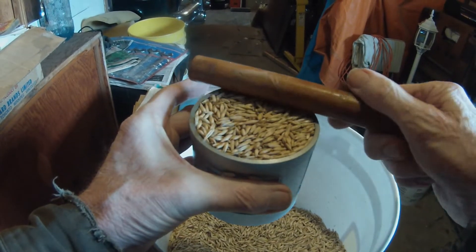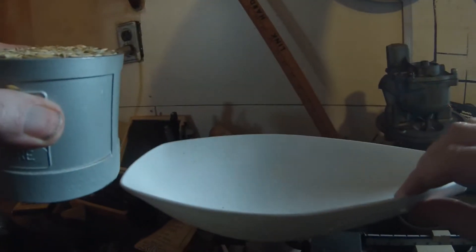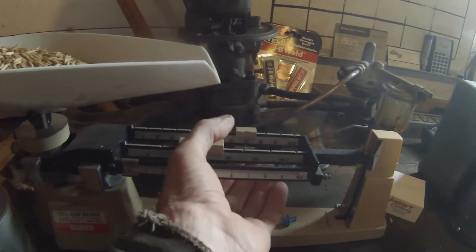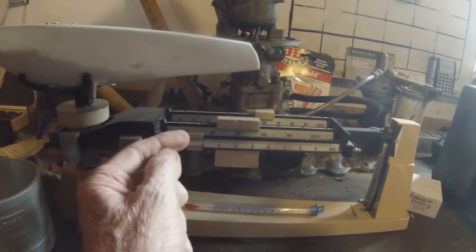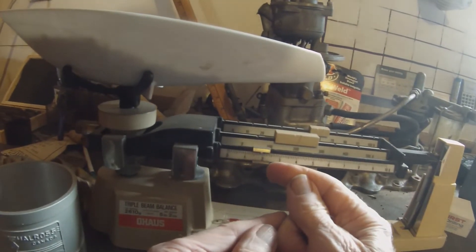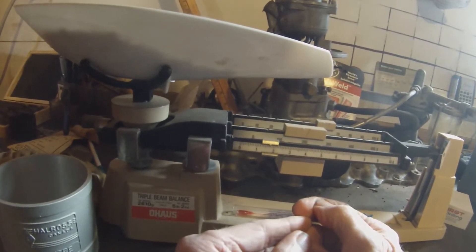When no more roll out, that's what I'm going to call good enough. So you take your special industry-approved measuring scale, carefully pour it in so you don't spill any, and take a reading. We're over 250, over 260 but not 270. We're going to call that 261.8.